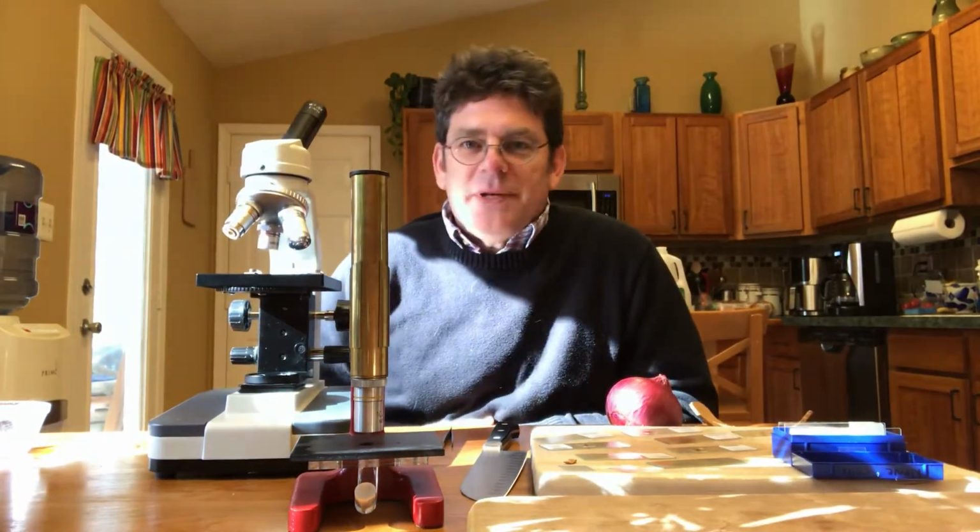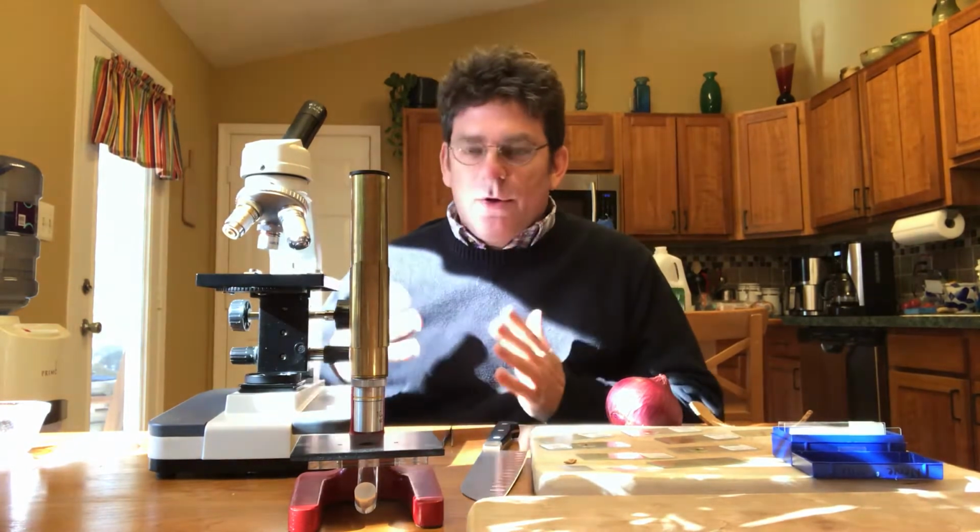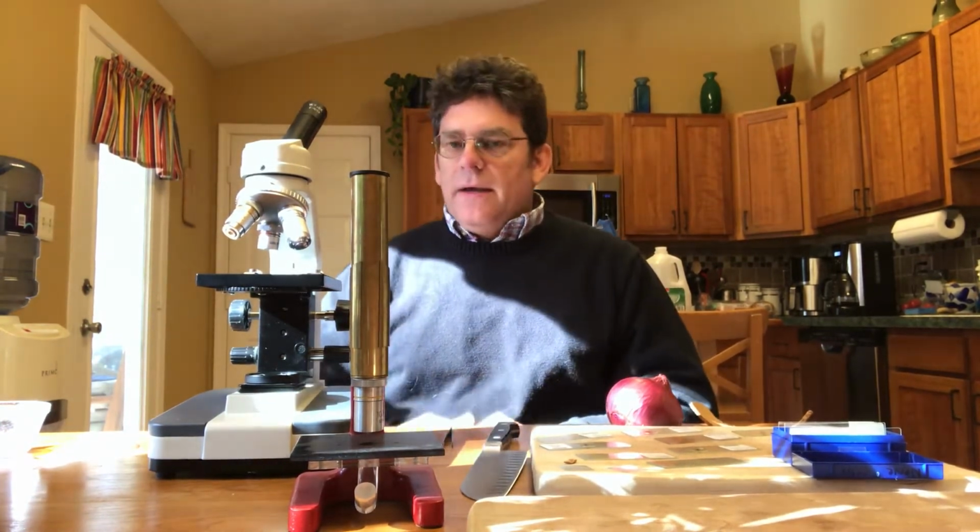Hi everyone, this is Mr. Maneno from Gainesville Middle School, and today I'm in my kitchen and I want to do a short video about how to use a microscope.